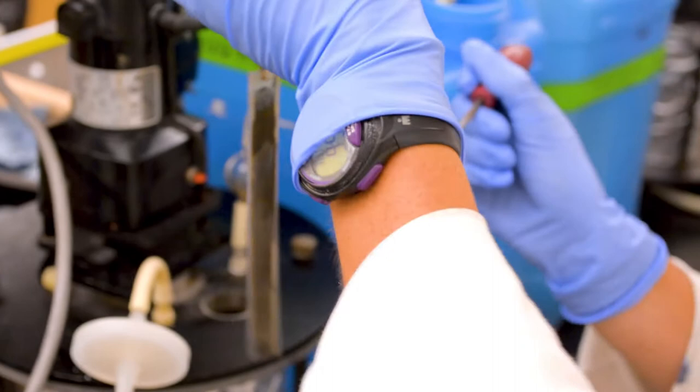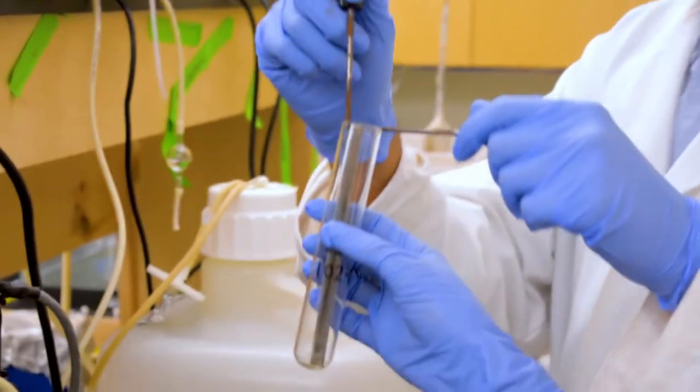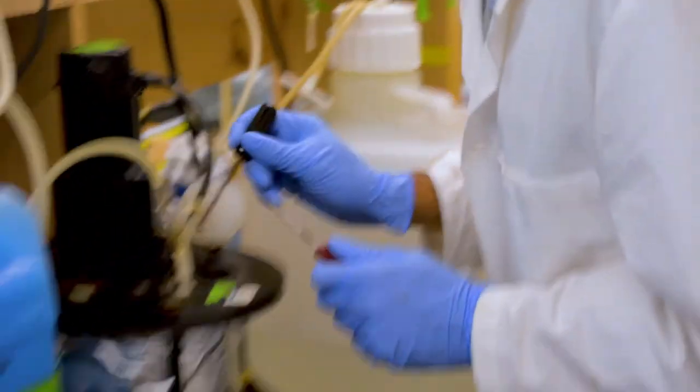We were halfway through our experiment, so far. Each week there is more and more biofilm on it. We've been taking the masses of the coupons to determine the mass of the biofilm. Every week it's going up.